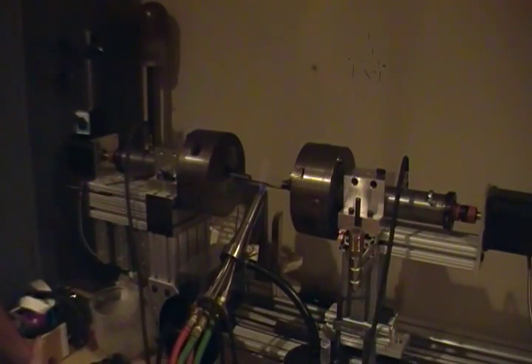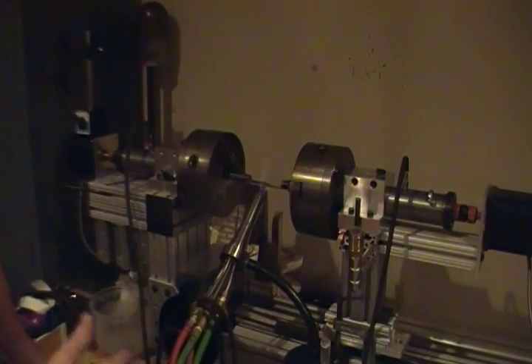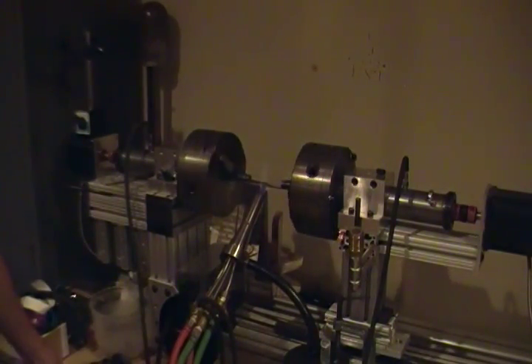I'm just going to do a separation and kind of test tube bottom, make two test tube halves, short test tubes, the prefab for a part. And so I'm using quartz as opposed to Pyrex or borosilicate or other soft glass. This is pure silicon dioxide. It's pure silica quartz, also known as clear fused quartz. And it's pretty extreme as far as glass blowing goes.